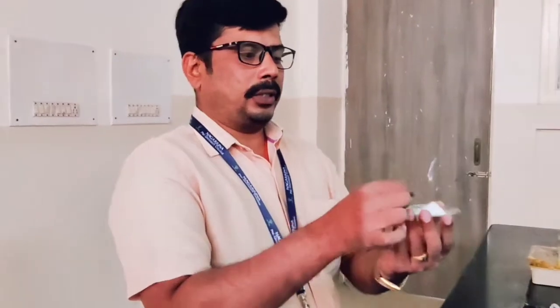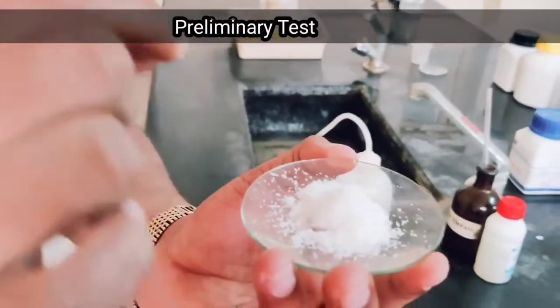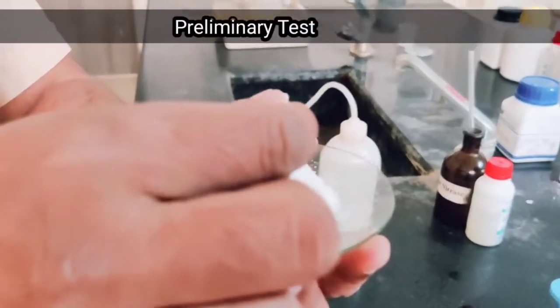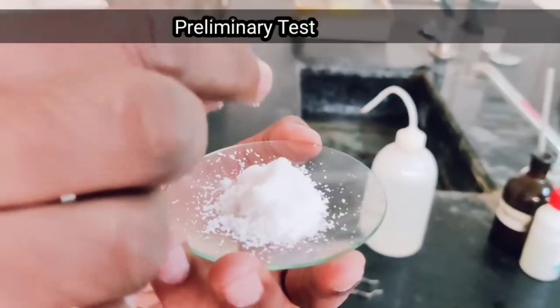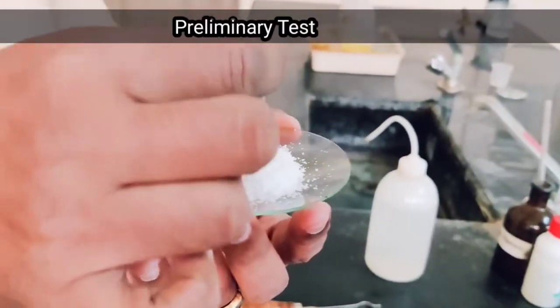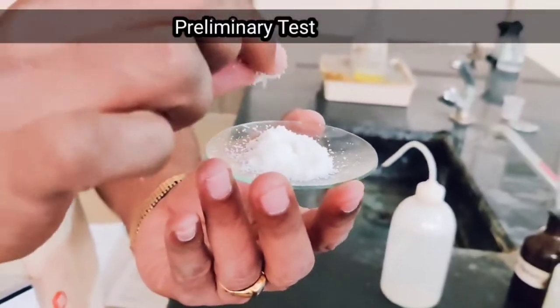The first step is to write the preliminary test for this salt. First, write the state. What is the state of this salt? It is crystalline — you touch it and it feels rough, so it is considered crystalline. Then, what is the color of this salt? It is white, so you write white.